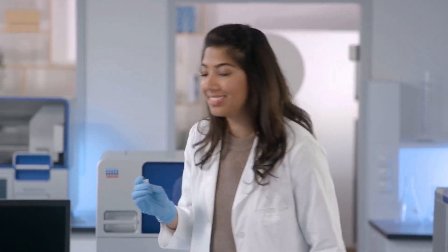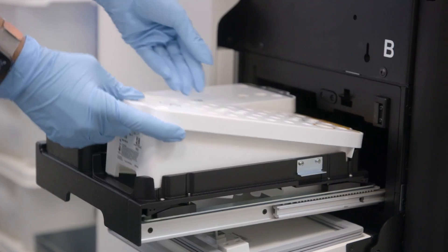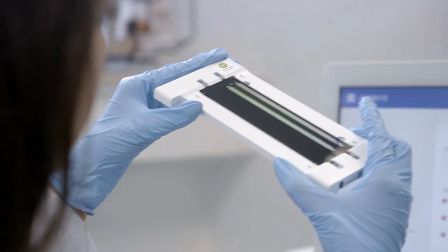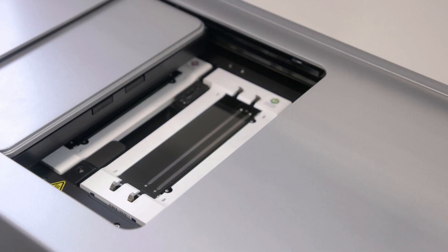This is the final library that will be inserted into the sequencing cartridge. I've loaded the sample and flow cell on the sequencer and started the sequencing run. Now we can easily review the sequencing run quality from the office.